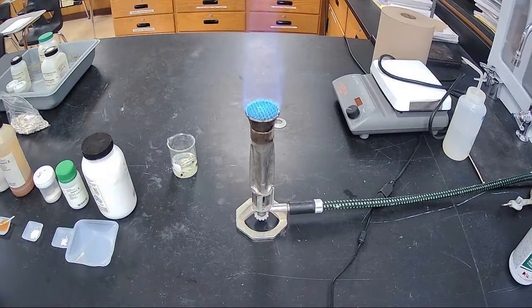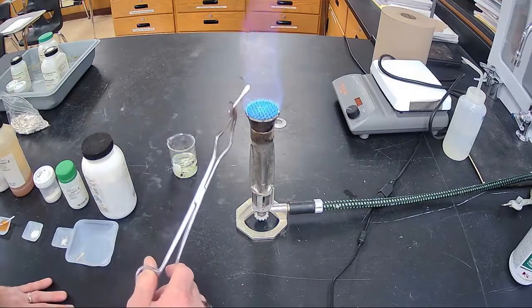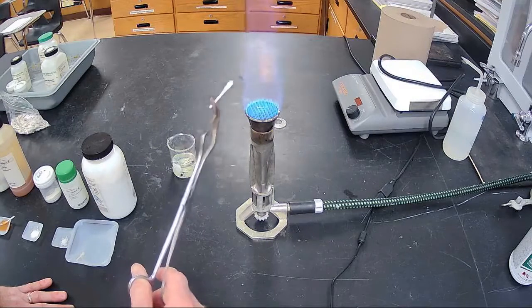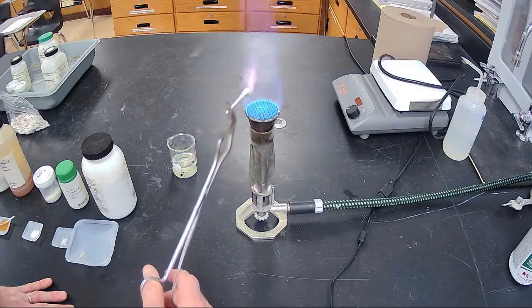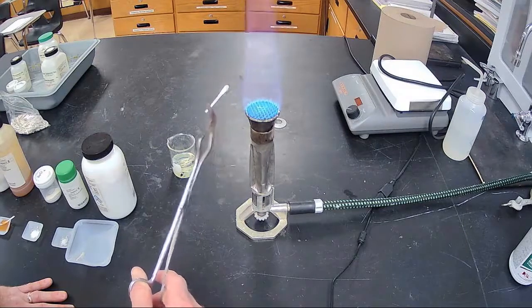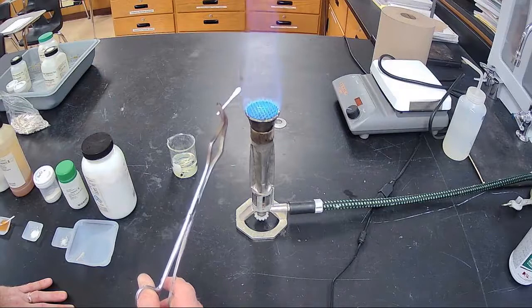I'm now going to do number 2. Be able to find the color of number 2. This one's very faint, so I put it in there. You can see it right on the edge. You can see the color. Right on the edge. Right there. See the color? There.